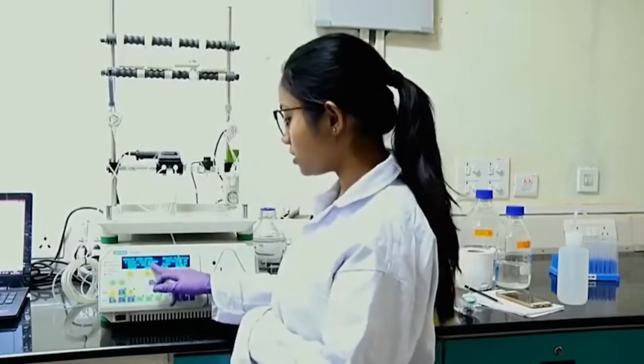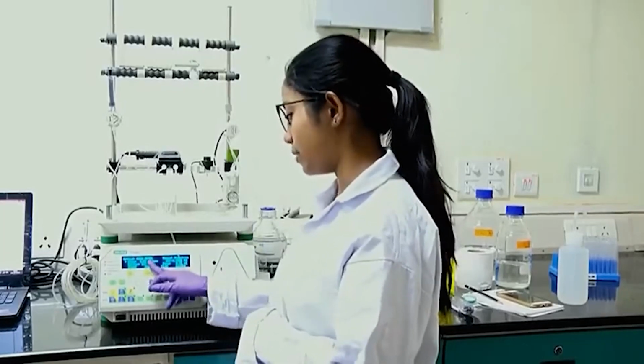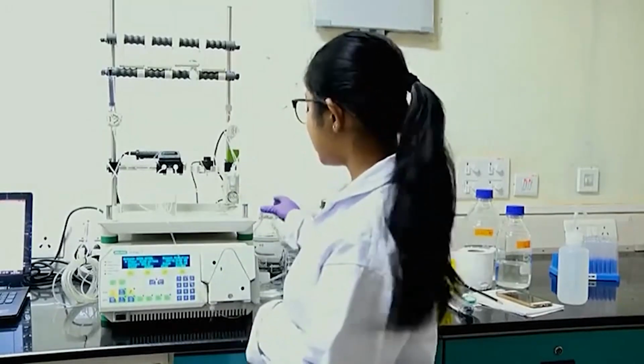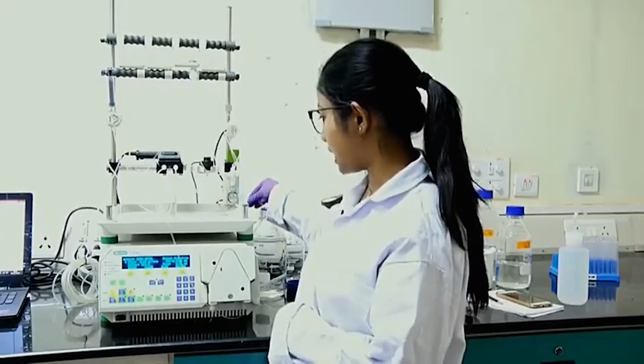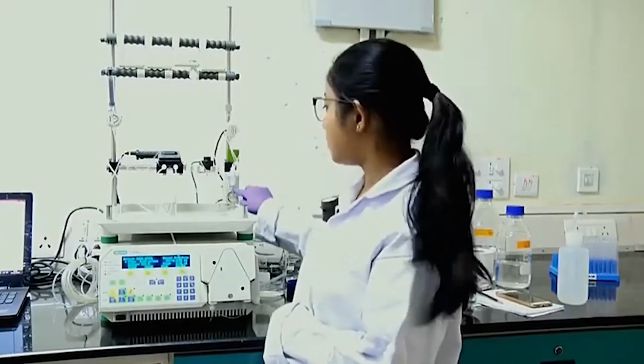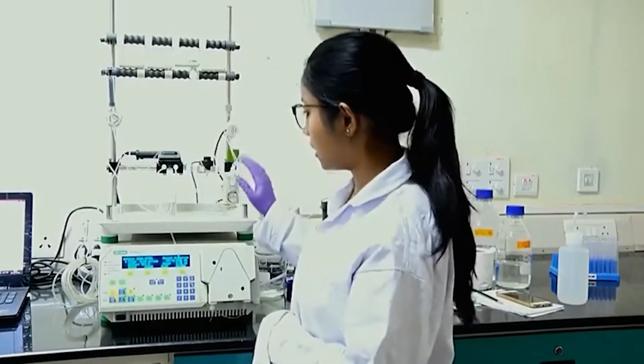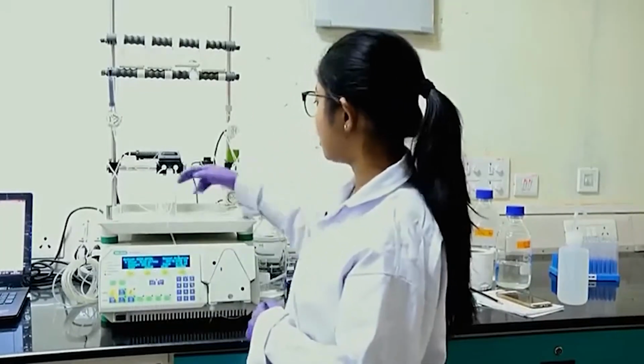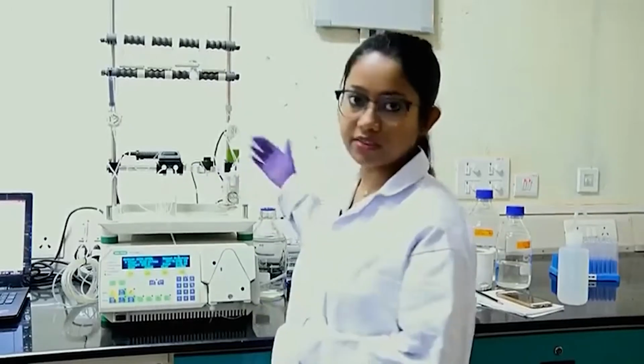So, I have mentioned it here as the flow rate is 5 ml per minute, and from both inlets, so buffer is 50% A and 50% B. So, basically it will take from both the channels, take the same amount of water and mix it, and then pass through my column and the tubes. So, by this way everything will be cleaned up. So, I will start, and it will take out this water and start rinsing the tubes and my column.